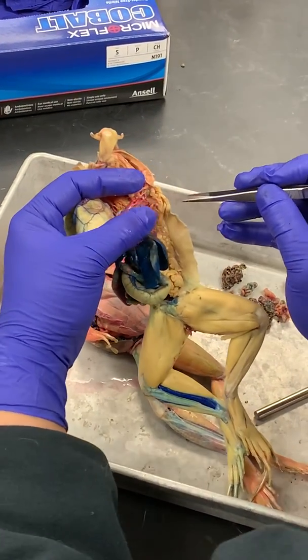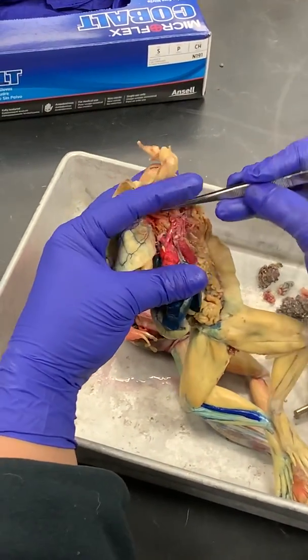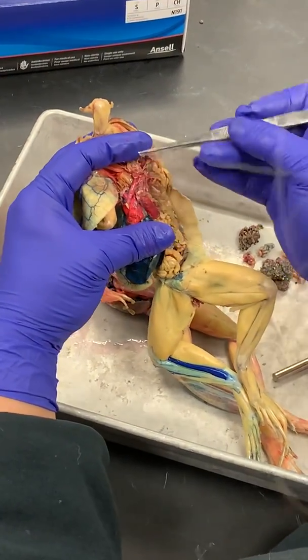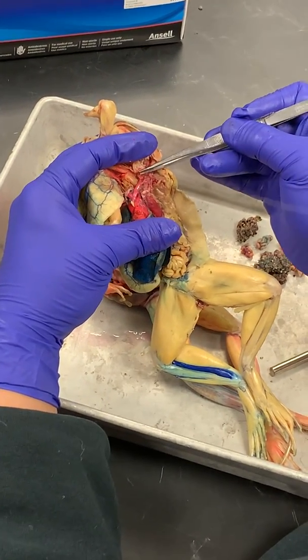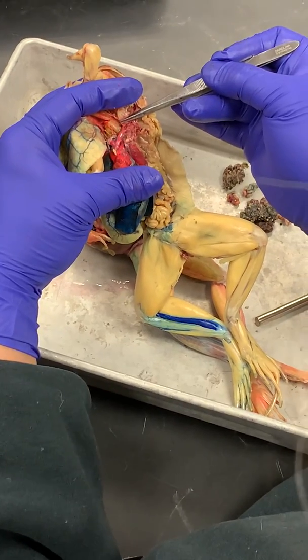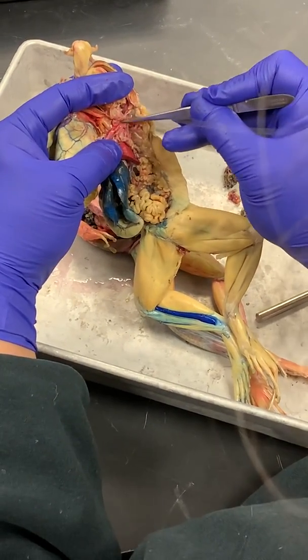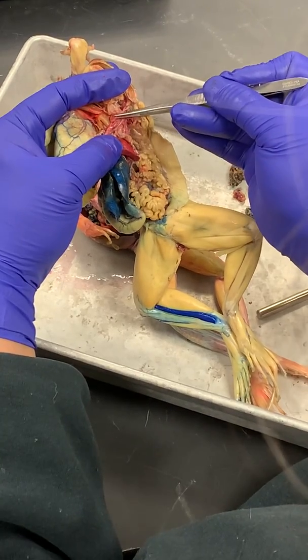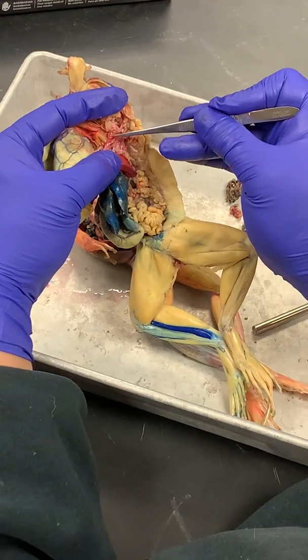Carotid arch. Did I say carotid trunk or carotid arch? Carotid trunk. All right. So look, the carotid trunk splits into two vessels. There's this medial one. This is the external carotid artery. And then we know that this one on the lateral end is the internal carotid artery because it has that bulb.